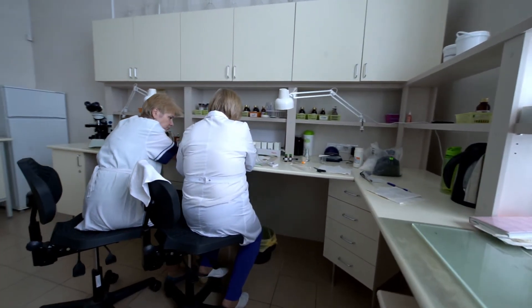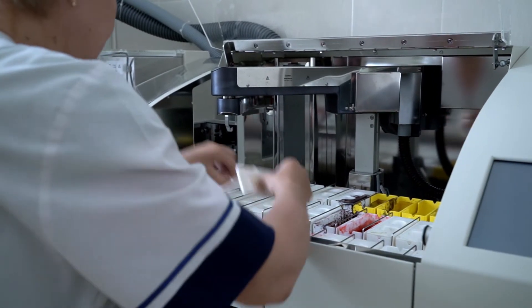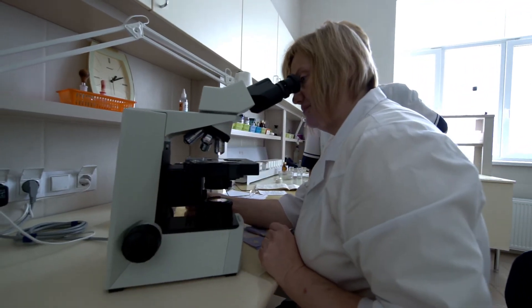Moreover, different pathologists have different preferences, and the results of the staining should satisfy them. Today we will stain slides with different types of hematoxylins and eosins, with different times of exposition, and then we will compare the results.